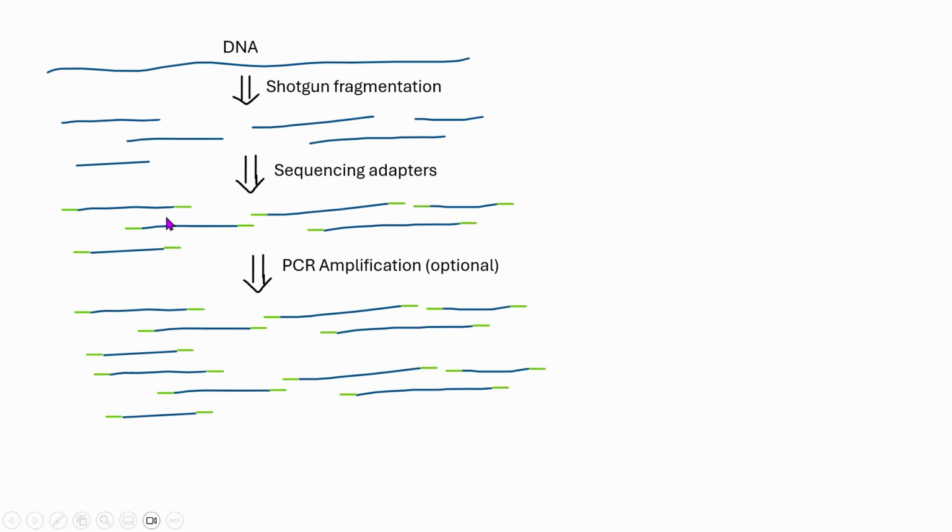So for higher quality sequencing, we need to amplify, we need to copy these fragments multiple times to increase our input DNA amount. So that is where PCR amplification comes in. PCR means polymerase chain reaction. In PCR amplification, we make multiple copies of the same fragments and keep them in our sequencing solution. So PCR amplification is the major source of GC bias. Why is that? It is because PCR amplification does not work equally well for all fragments. So maybe for some fragments it will create 10 copies. For some fragments it can only create 5 copies.